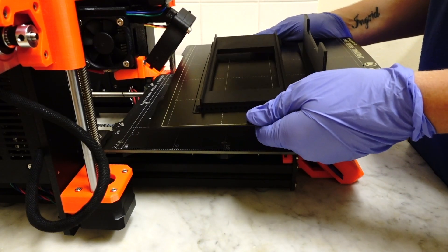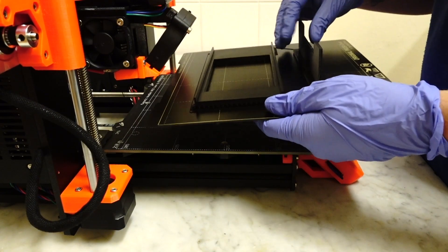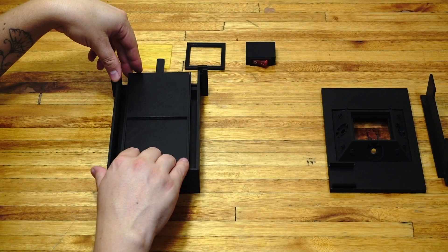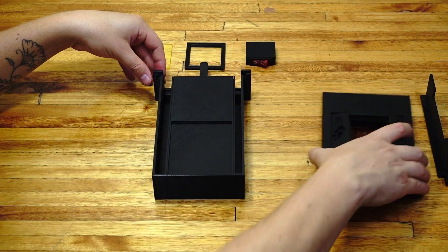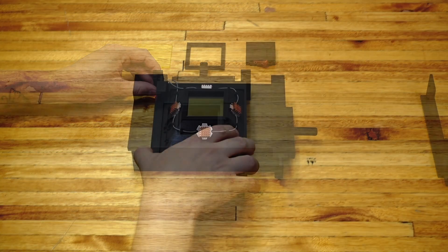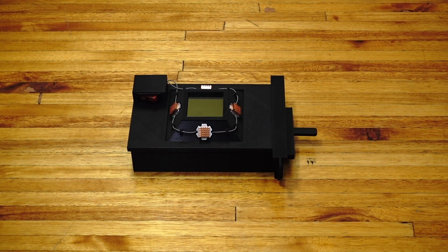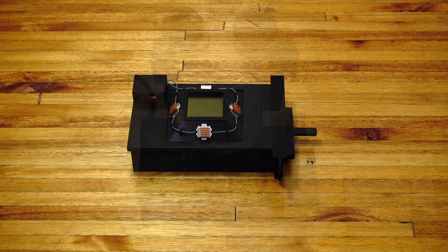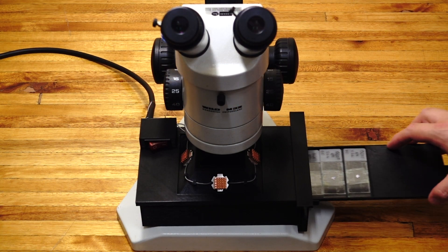My first few designs were made out of wood and were a bit hazardous. I decided that if I'm really going to get people to use this method in general, I would need to come up with a box that everybody could make themselves, so I started designing a box that could easily be 3D printed.